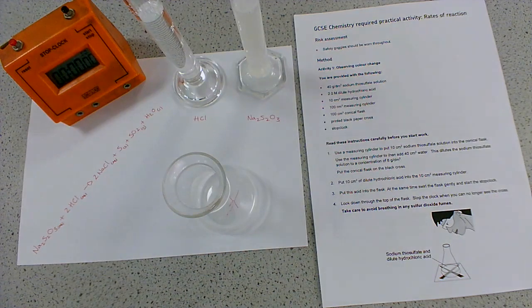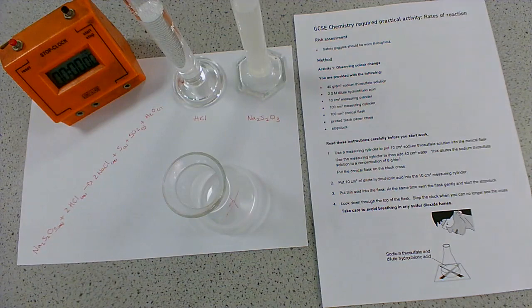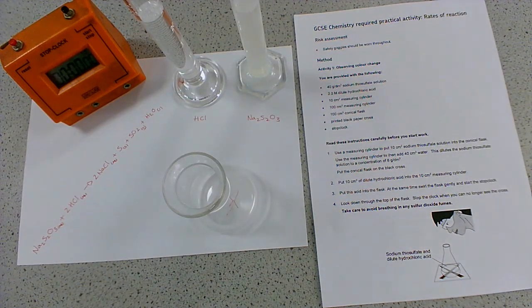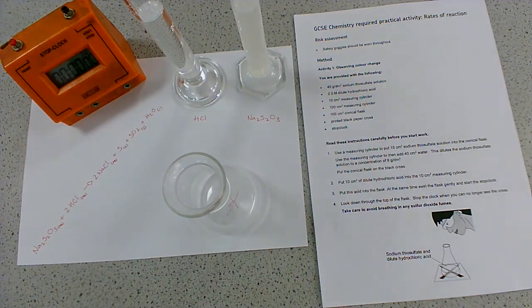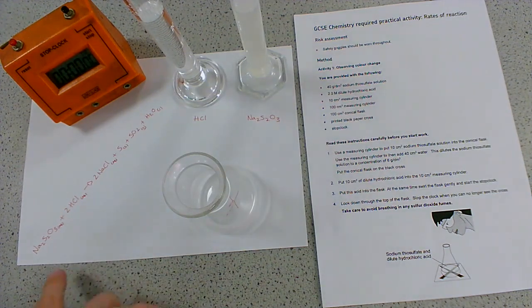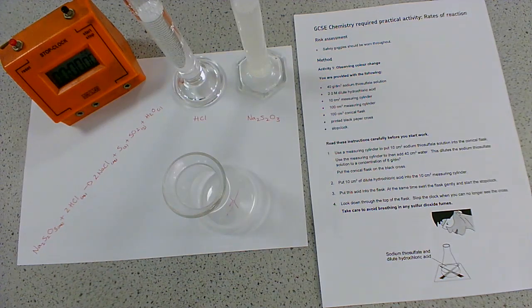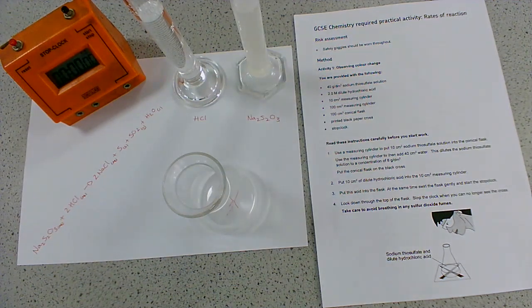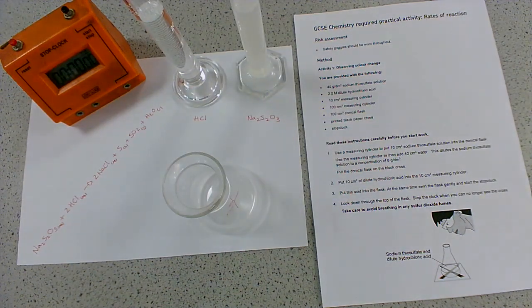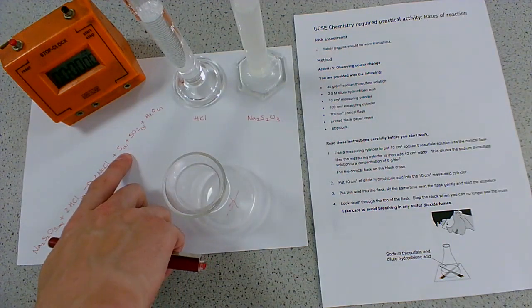This first one is the disappearing cross reaction. This is a method we use in a reaction where we have a distinct colour change - most commonly the reaction of thiosulfate with hydrochloric acid. You don't need to know the equation; if they ever ask about it, it will be provided. But you do need to be aware of this reaction. When you react thiosulfate with hydrochloric acid, it produces solid insoluble sulfur.